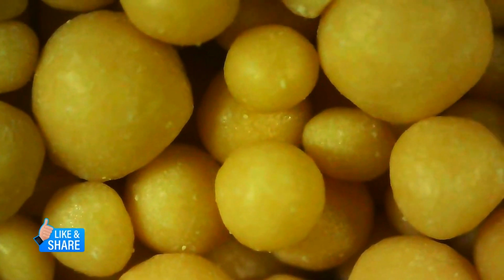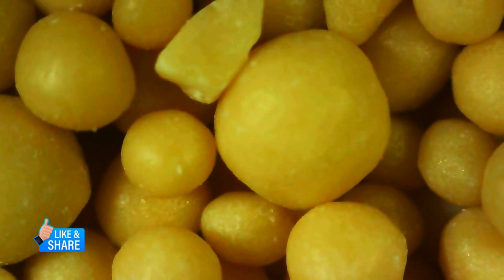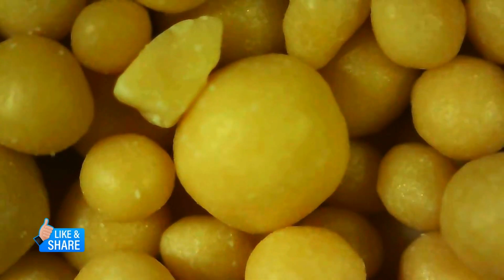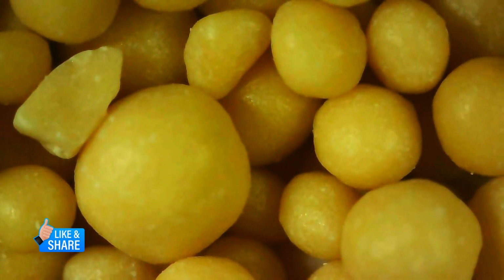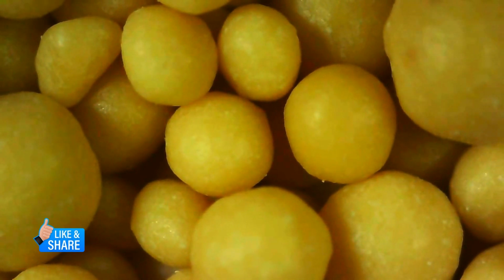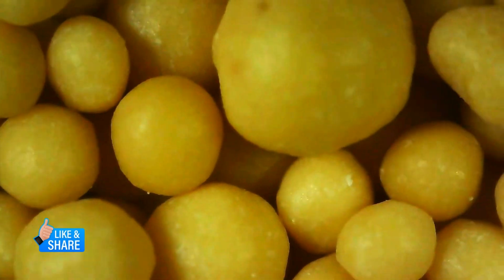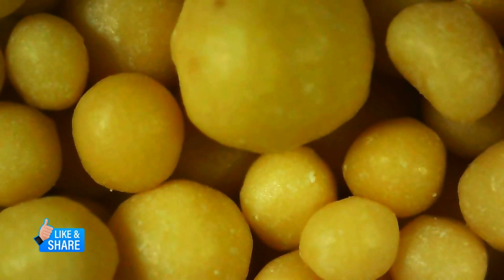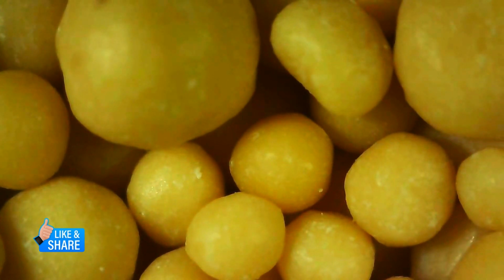As we zoom in, the intricate features of SAF yeast come into focus, revealing a fascinating array of textures and patterns. Each granule holds its own story, waiting to be discovered. While it may seem unassuming at first glance, SAF yeast surprises with its complexity and unique characteristics under closer examination. Join me as we unravel the mysteries of this humble yet remarkable substance.